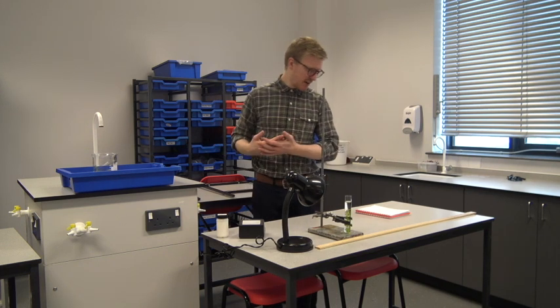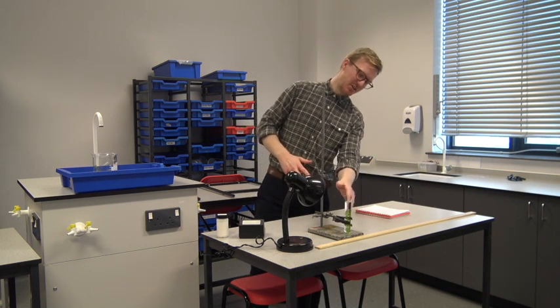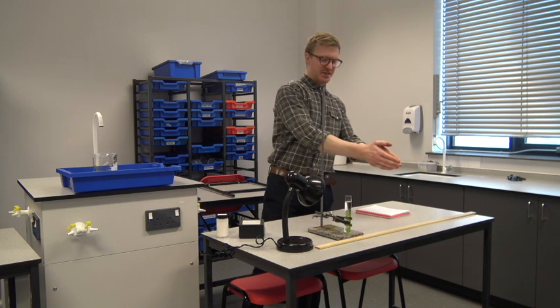So this practical is all about rates of photosynthesis. And the way we're going to measure that in this situation is to measure the amount of bubbles that we see coming off the pondweed every minute at the different distances.